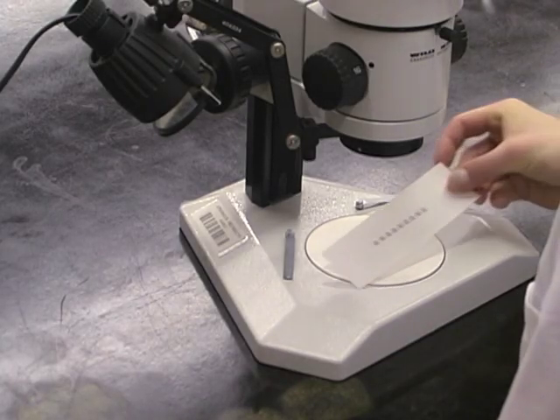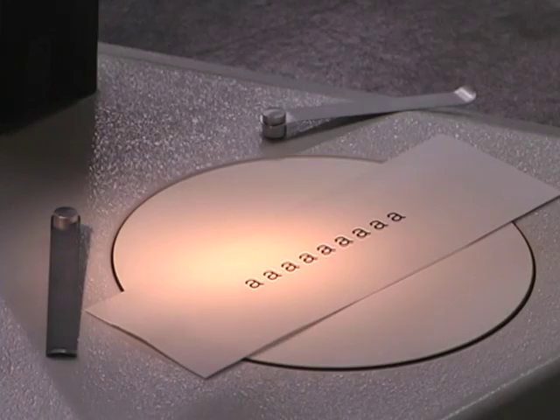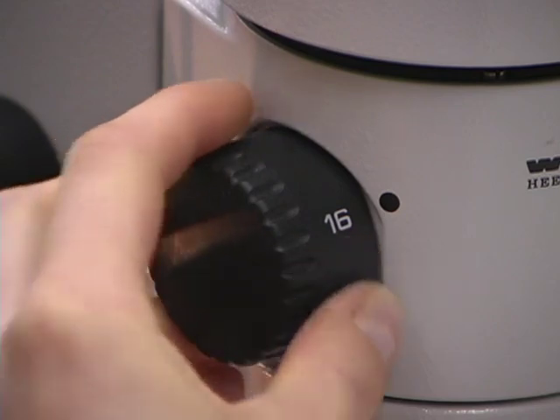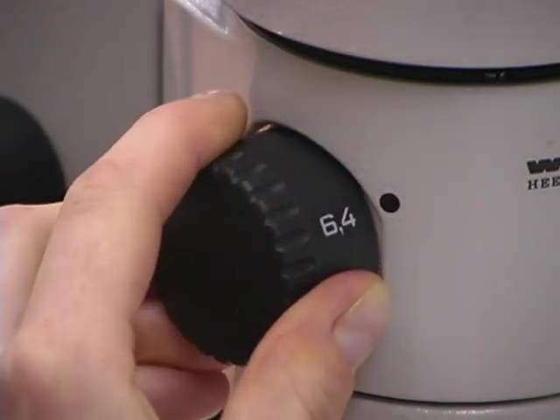Now we will use the microscope to view an object. To start with, use a flat piece of newspaper or a series of printed A's or E's as an object. Plug in the light source and adjust the microscope lamp so that the object is illuminated evenly. Move the objective lens with the lowest magnification into position — the lowest objective lens is labeled with the lowest number, in this case 6.4.